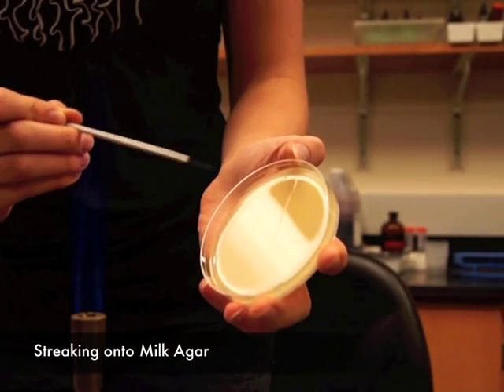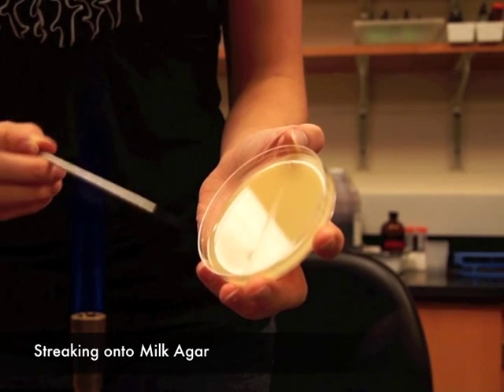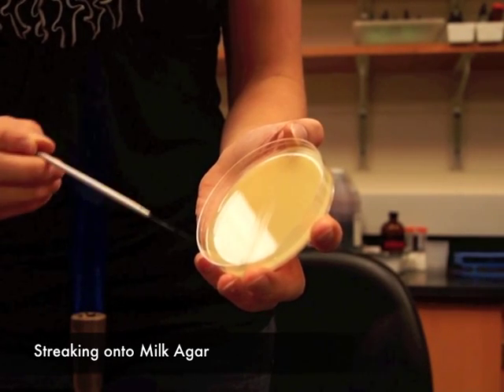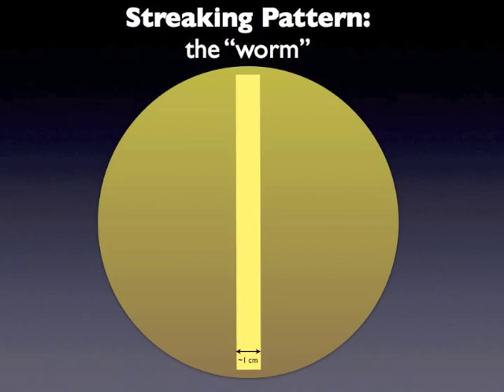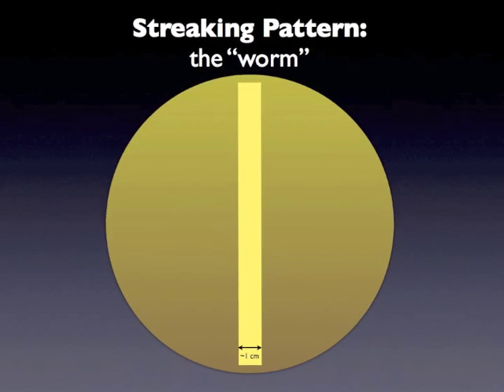Spread the sample onto the milk agar plate by streaking back and forth across the diameter of the plate. The total width of your streaking should be about 1 cm. This streaking pattern is referred to as the worm.